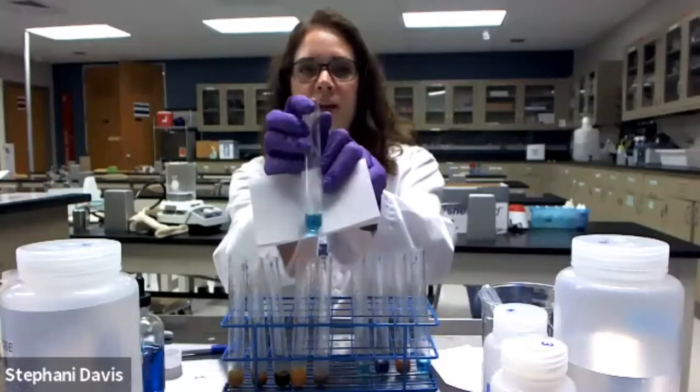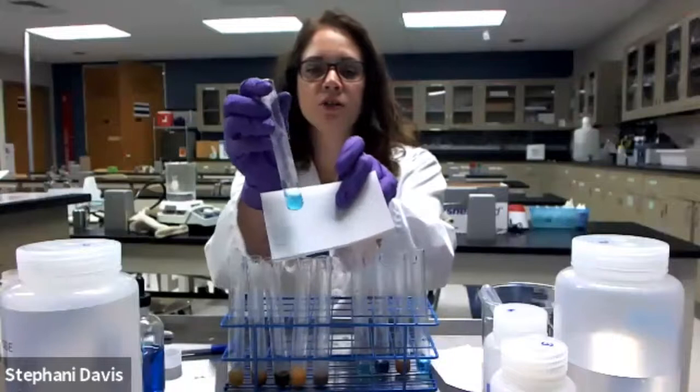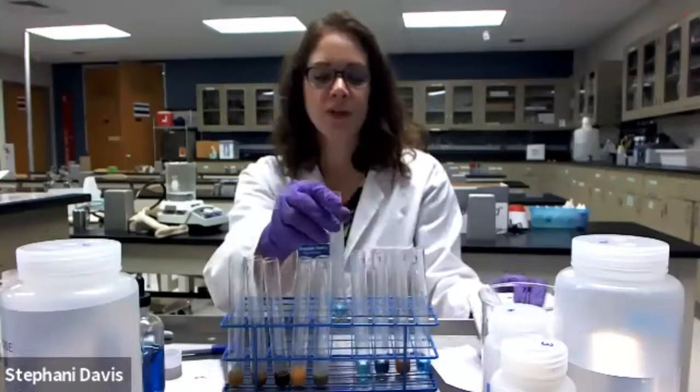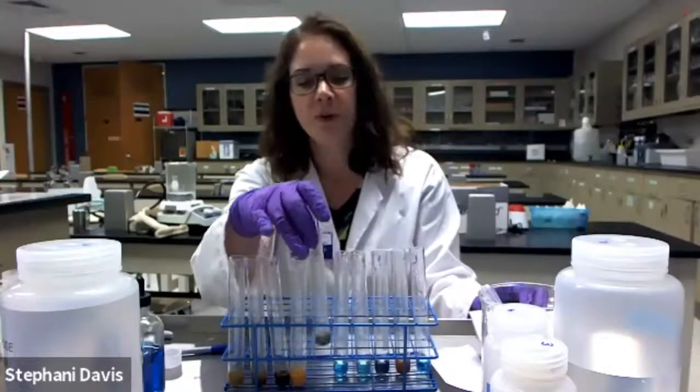Why? Starch is a polysaccharide. Remember, the Benedict's test is only going to detect simple sugars, monosaccharides. Now, sucrose is a disaccharide. Still, that doesn't act as a reducing sugar. It's still not a monosaccharide. It's 2 monosaccharides linked together through dehydration synthesis. So we get a blue color indicator. So no orange color, meaning that it's negative for the Benedict's test.